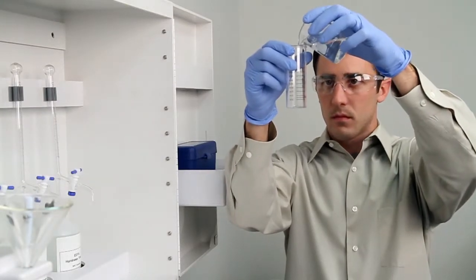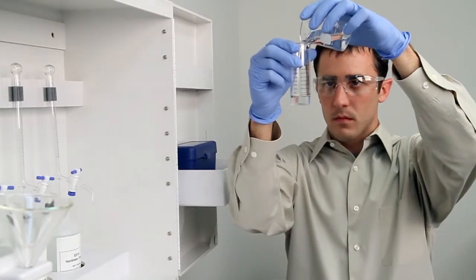To get an accurate sample, hold the vial close to eye level. Accuracy is very important during this step.